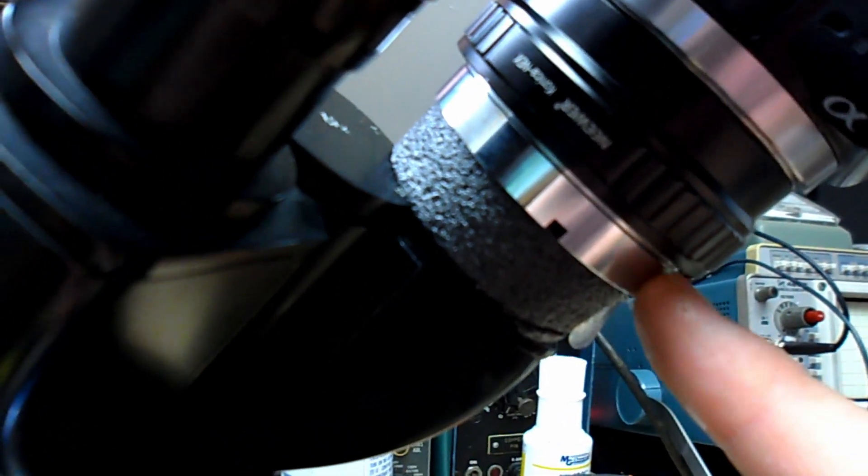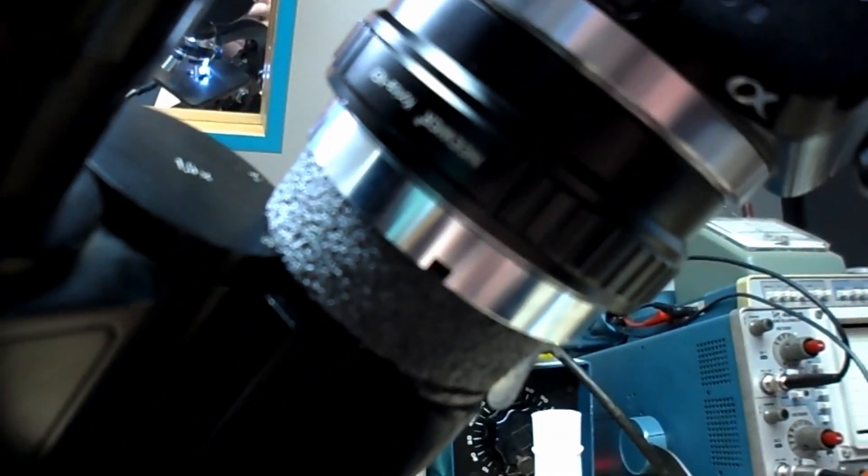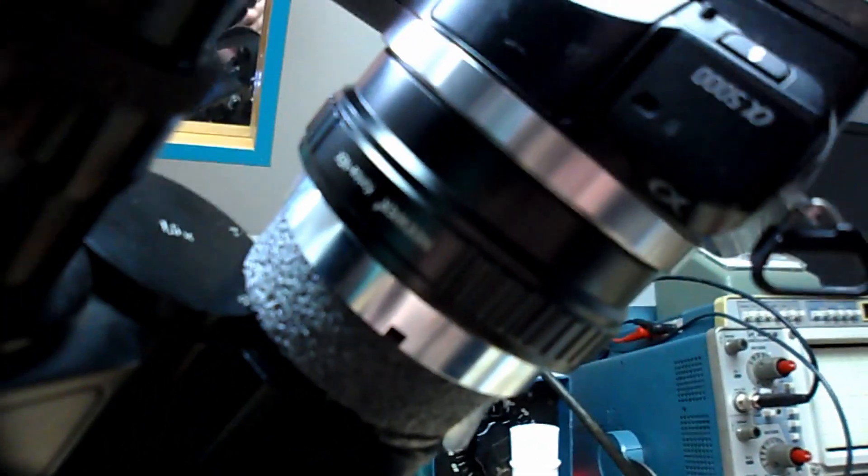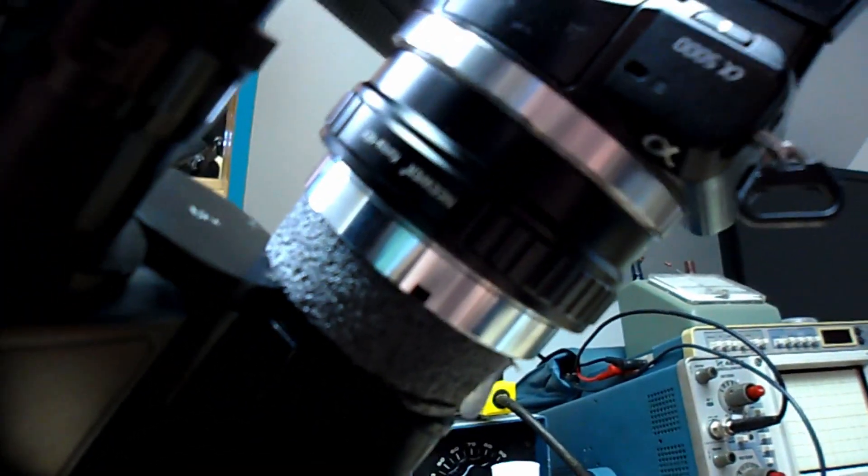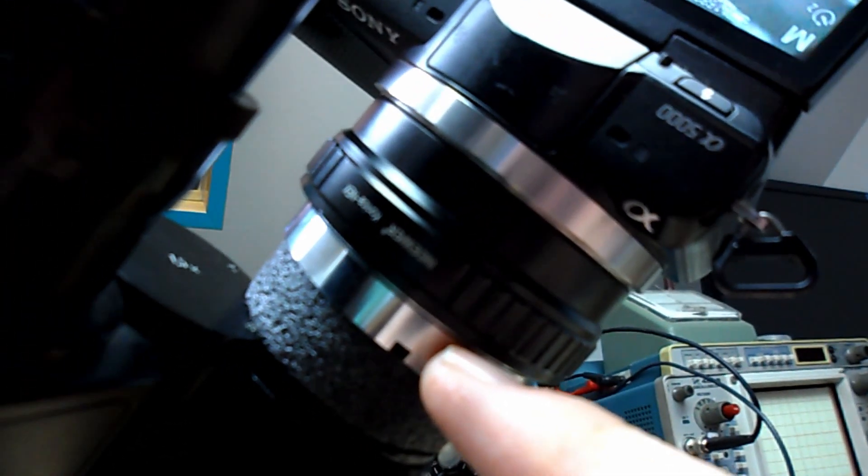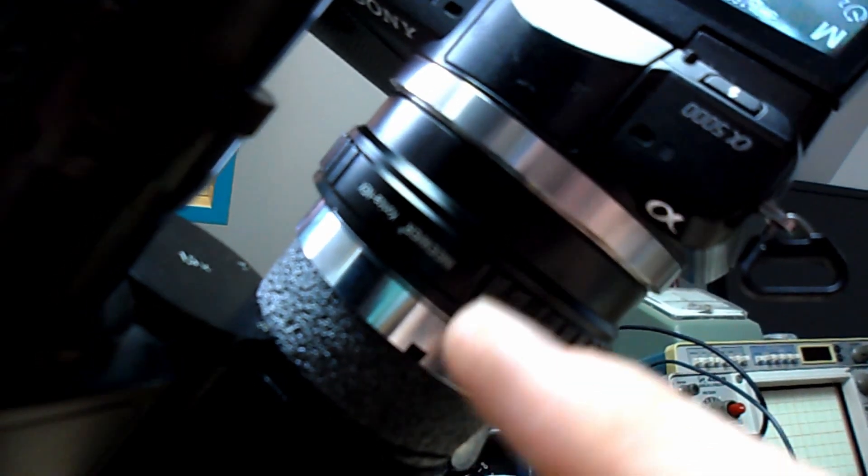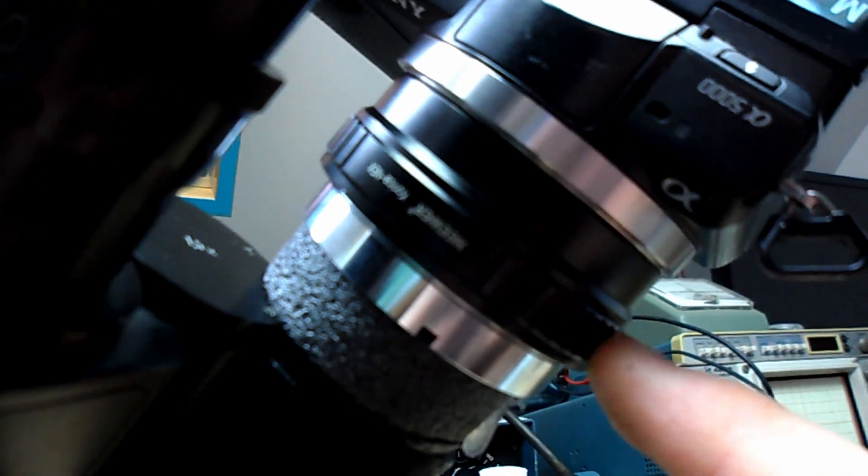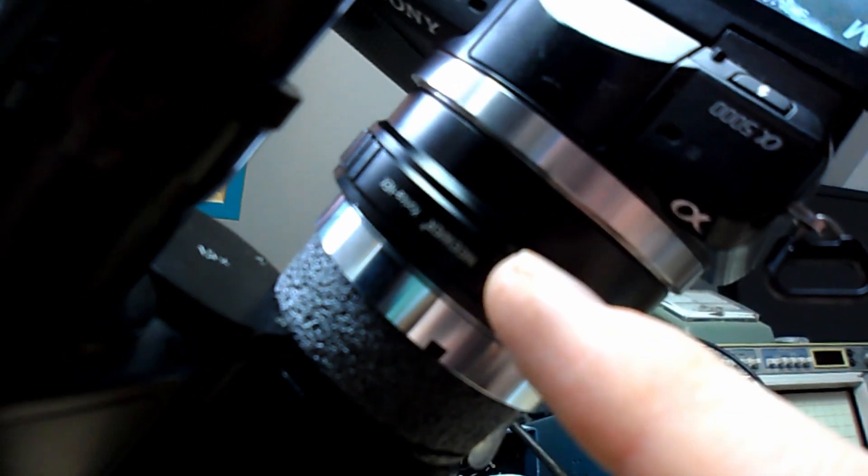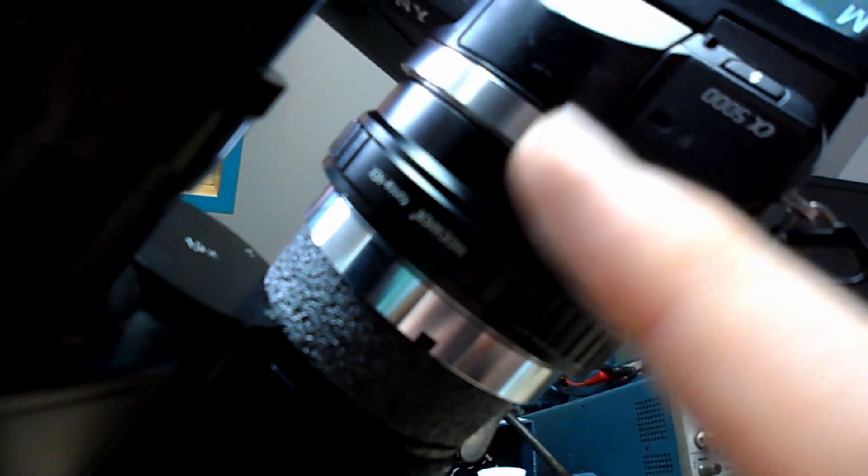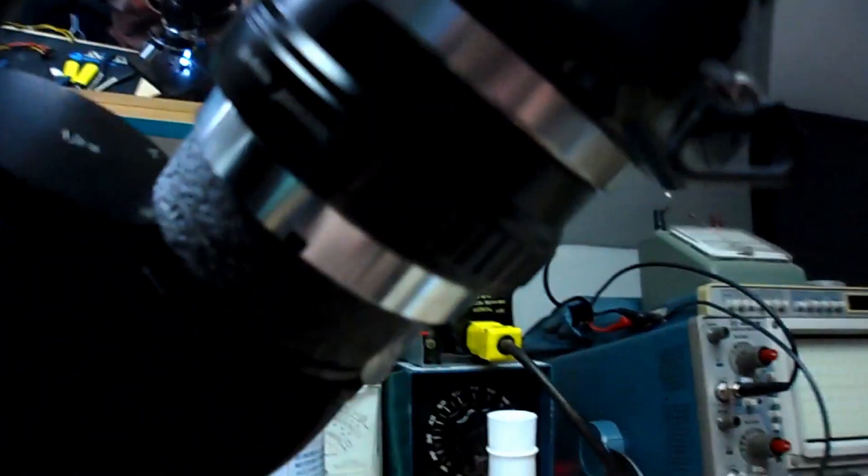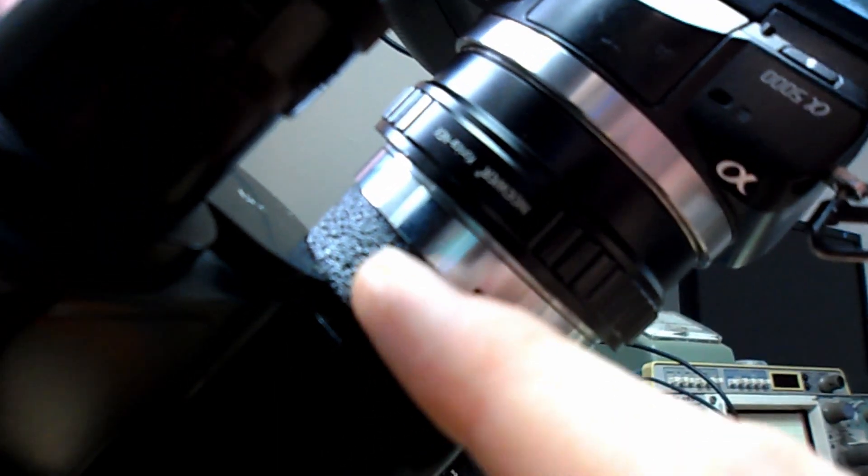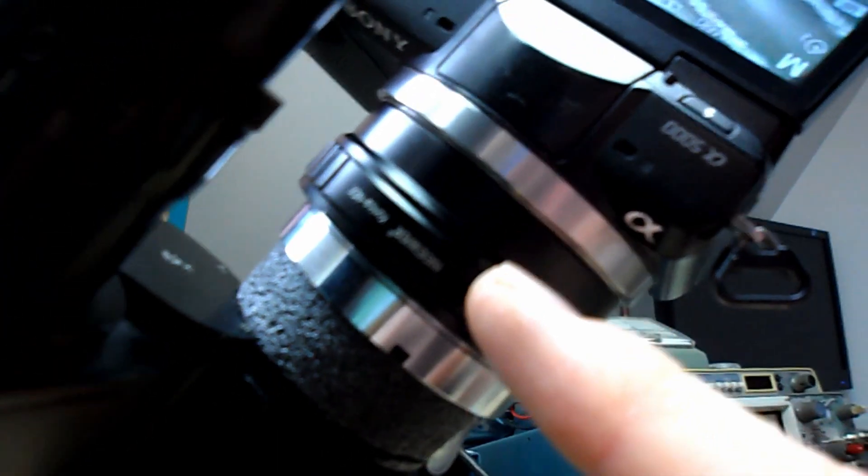This is the back end of a discarded lens that I opened up one day and could never figure out how to put back together, but anyway it wasn't an expensive lens thankfully. This part is basically the locking mechanism. It's a Konica adapter to Sony, to this particular a5000 camera. This piece is hot glued to this foam and then it snaps into the adapter so the camera is hanging off.